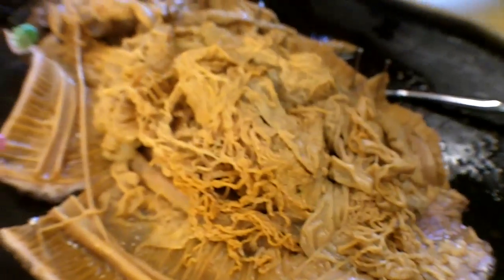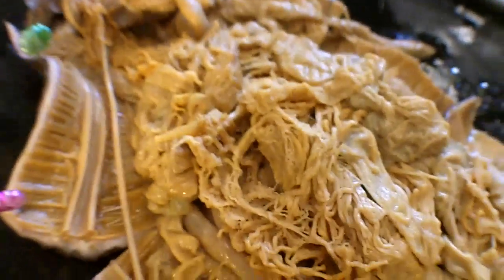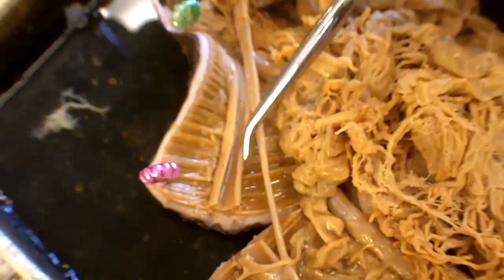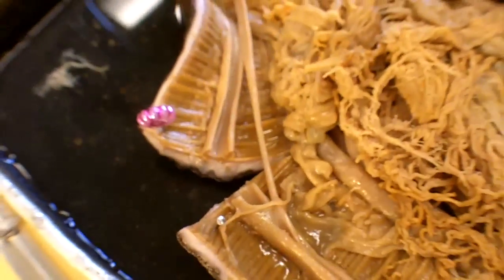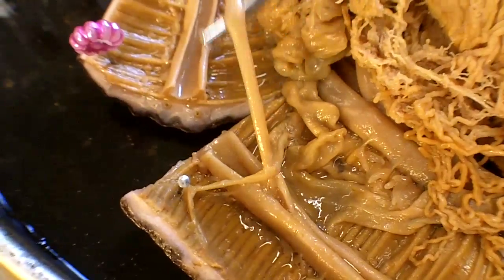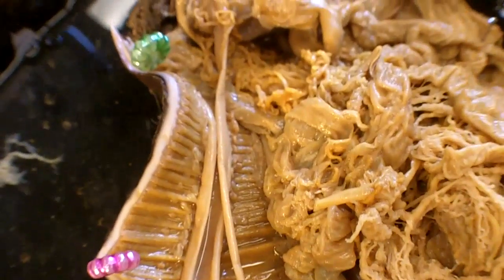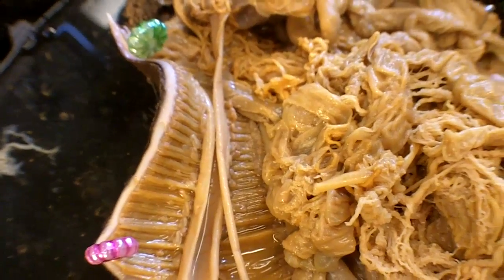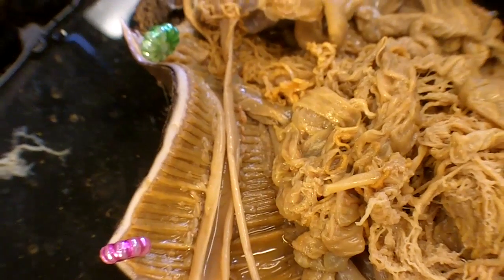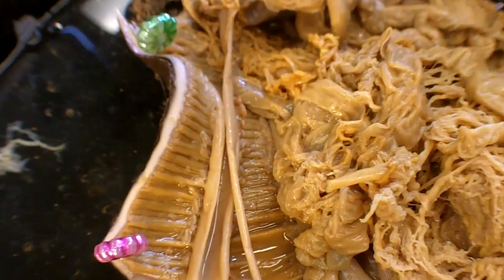There are a couple of distinguishing features or things you can see coming out of here. We've got, as I said, the intestine. These are the longitudinal muscles along the side, up and down here. And this thing going to the center and attaching back to the longitudinal muscle is the introverter muscle — it's the muscle it uses to pull itself in. They're called retractor muscles, generally.